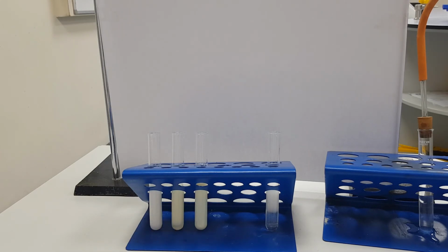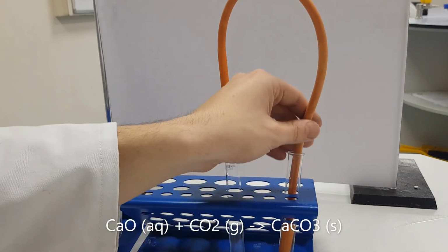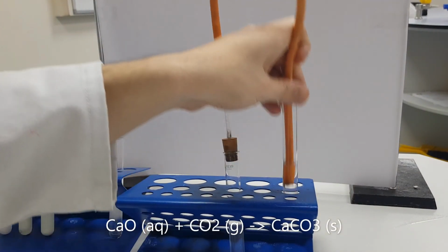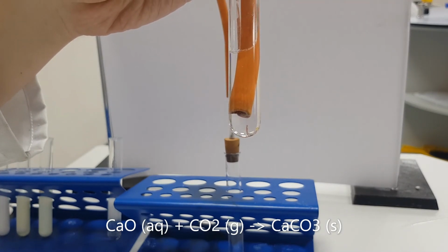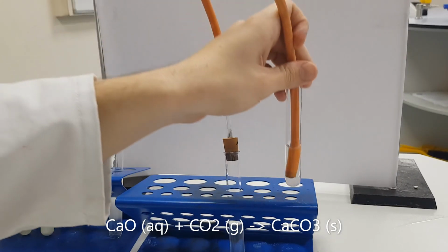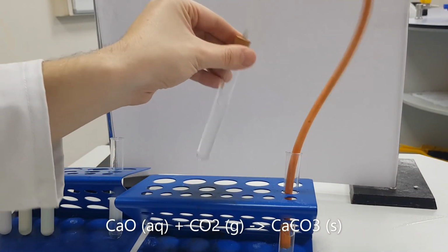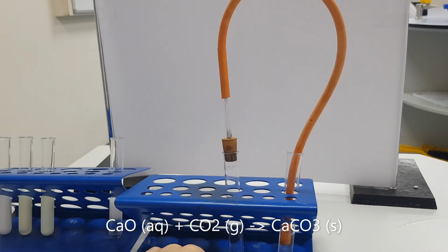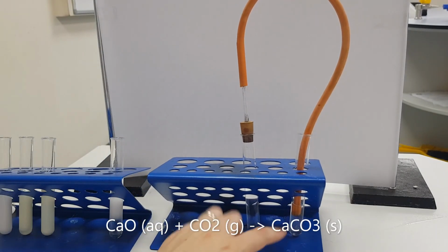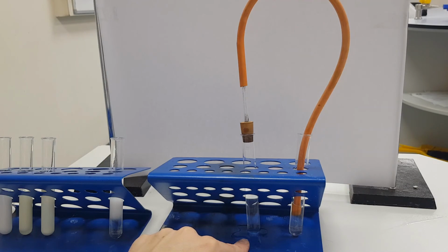If we now check our carbonate ion, we have had some bubbles and it is very, very slightly cloudy. I think the concentrations that I've used have produced very, very little CO2, but we can see a very, very small amount of clouding, which is a positive test for carbon dioxide. So the gas evolved from this is carbon dioxide.